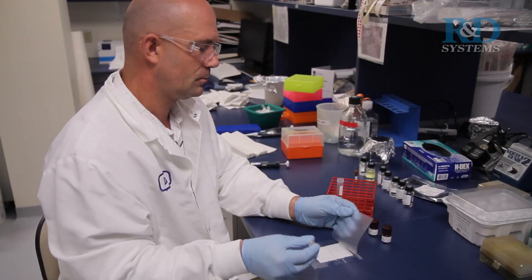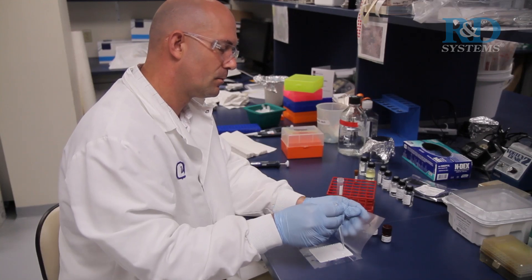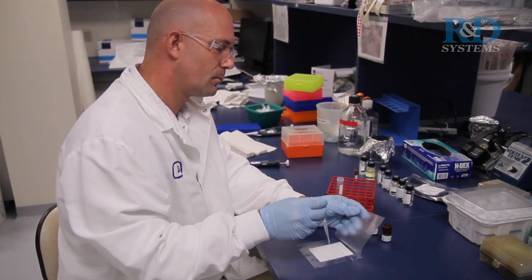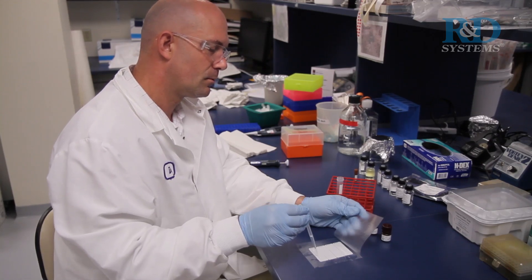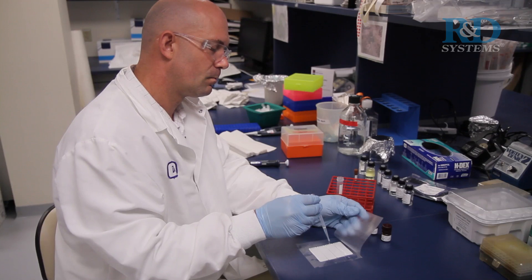Pipette 1 milliliter of the prepared chemireagent mix evenly onto each membrane. Using less than 1 milliliter of chemireagent mix per membrane may result in incomplete membrane coverage.